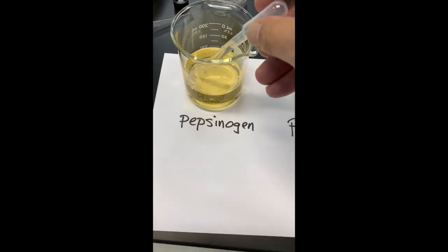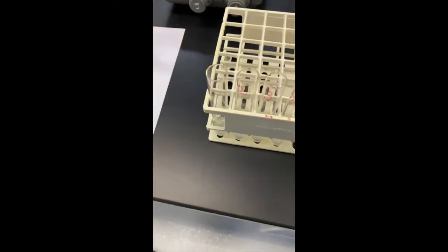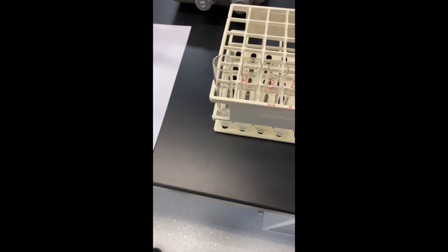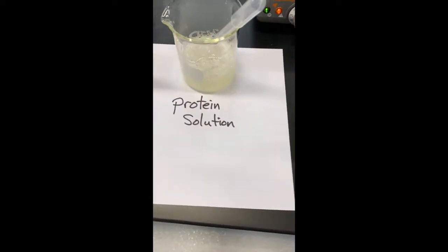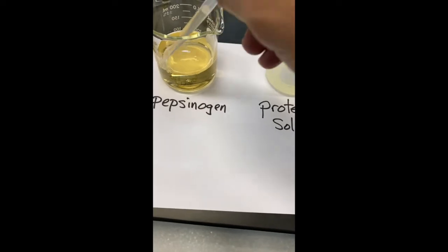And to test tube number 4, we're going to add 5 drops of HCl and 10 drops of pepsinogen.